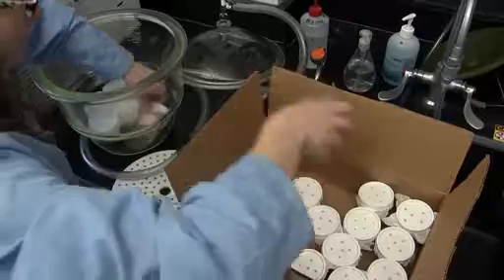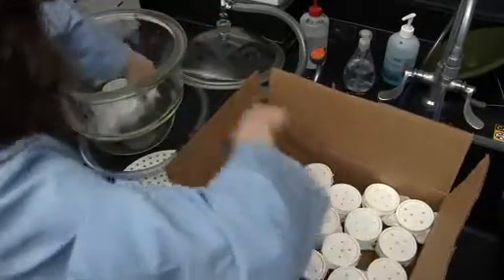Once soils are freeze-dried, store them in a sealed container with desiccant until extraction. It is best to store freeze-dried soils at -80 degrees C.